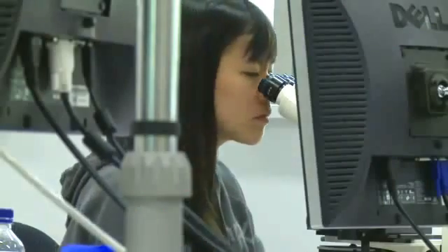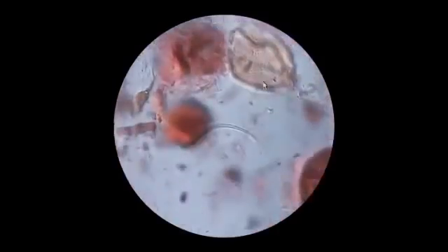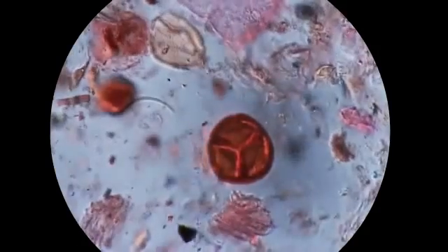But for some of the pollen we don't really know why. They're different shapes and sizes and have different forms, so we're still working out why. There are lots of different types. Right now the process of analysing pollen is pretty much looking down a microscope at all the different grains. You can't look at all the grains — you have to look at a sub-sample. It's quite a painstaking approach, and a job no machine was smart enough to do. Until now.